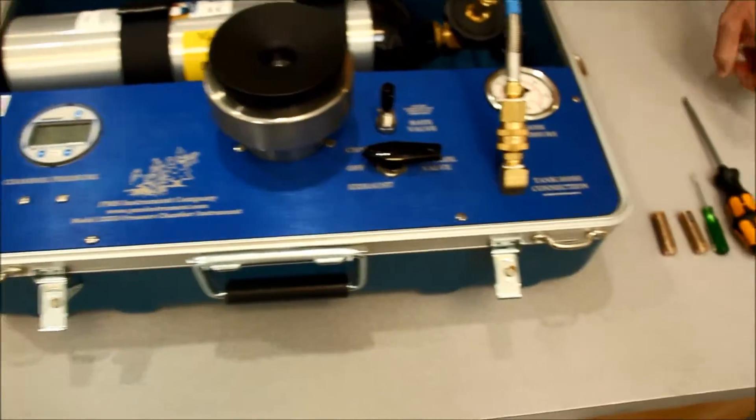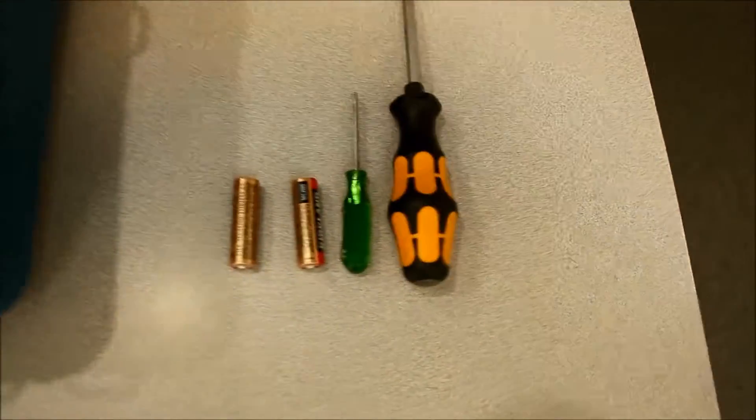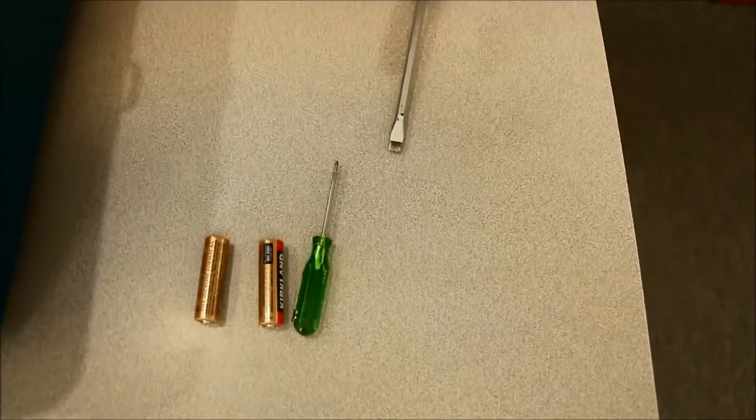These are the tools we're going to use. We just need a couple of flat head screwdrivers and a couple of extra batteries.